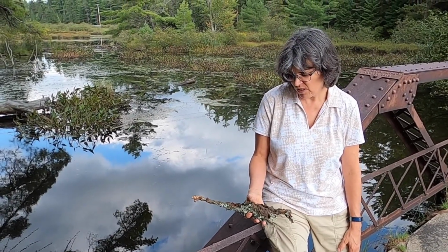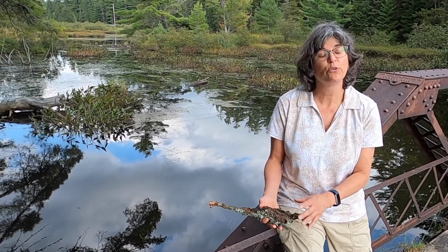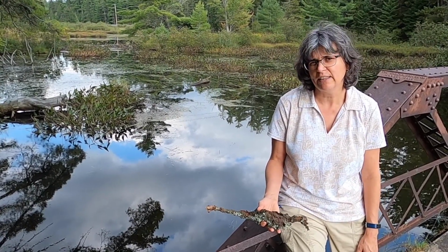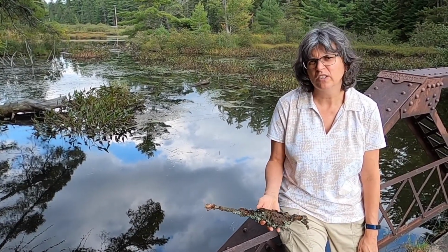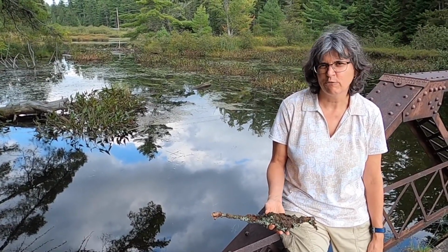So that also gives you a sense of the fact that fungi have lots of different growth forms in the fruiting bodies, and you can see a lot of variety in that. And having this very woody look is just one example of that kind of variety when you look across the different fruiting bodies of fungi.